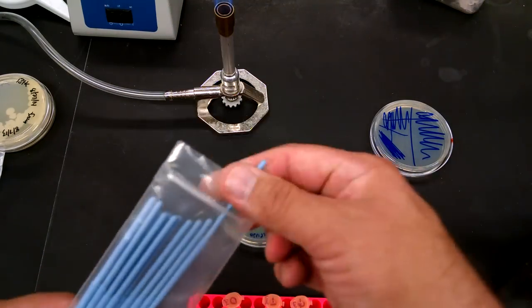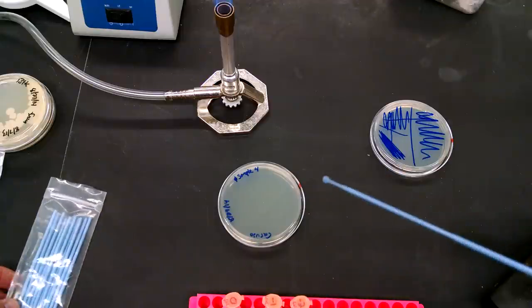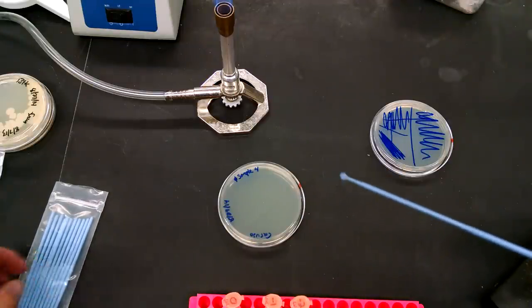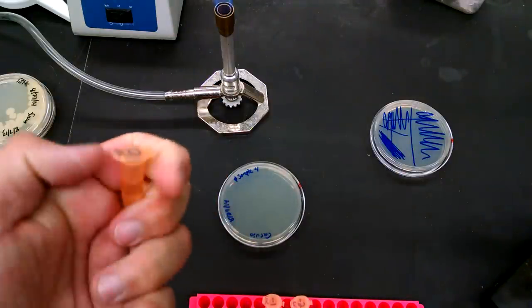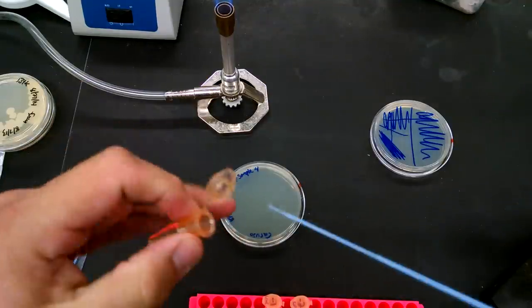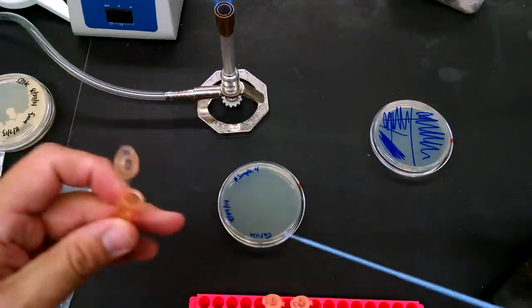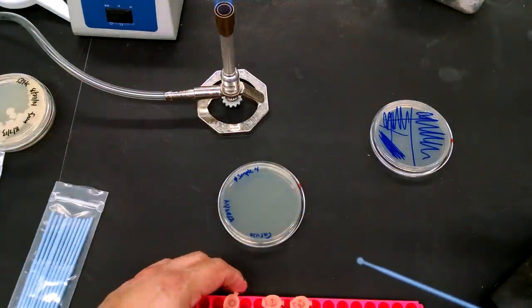Blue loops, the only difference, much, much smaller and pick up a smaller sample. But when you have your initial samples here, they pop right in. You'll pick up some of your phage.